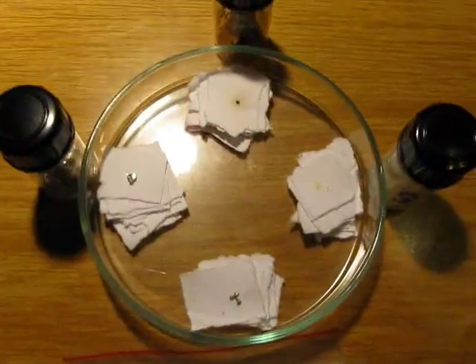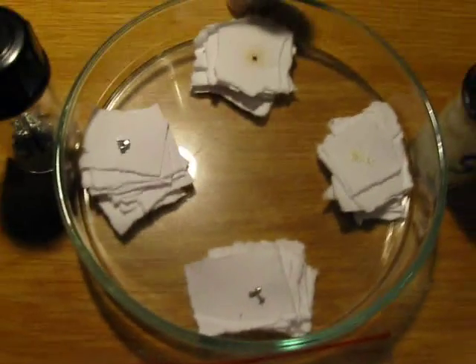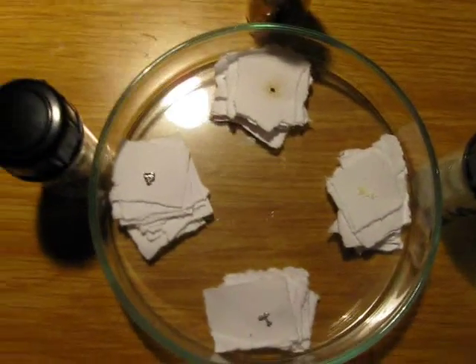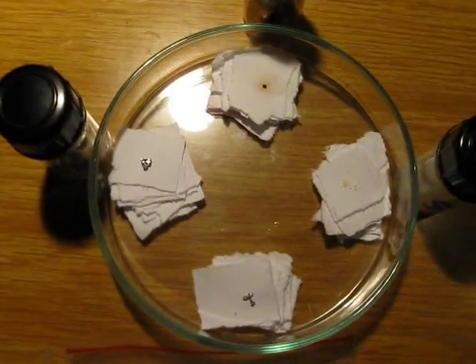Now all the samples are in place, and you can already see that there is quite a reaction from iodine, so I guess it probably was iodine. I'll give it a few hours and see if anything else happens.